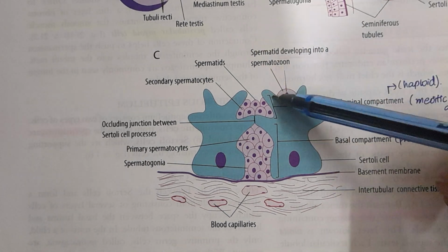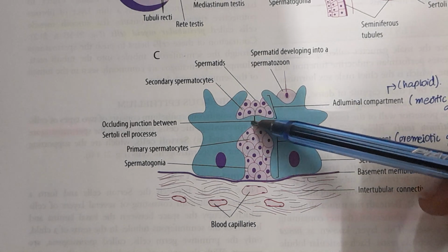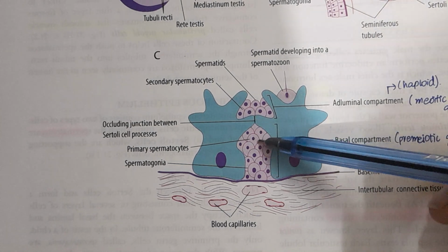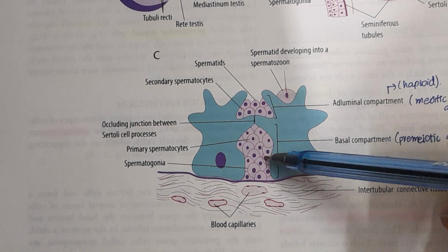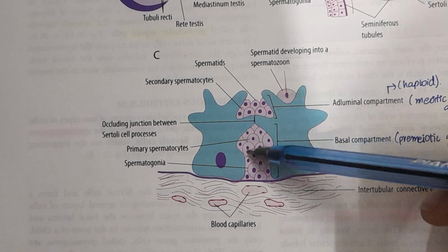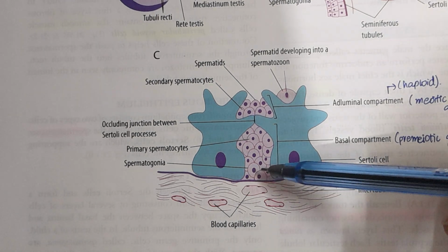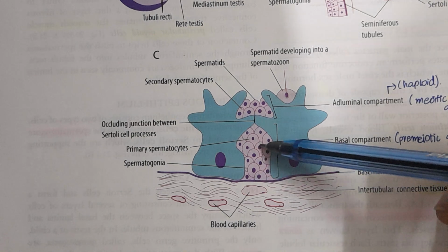A very important thing about their lateral portion is that they have cytoplasmic processes. These processes are joined to each other by zonula occludens or occluding junctions. These occluding junctions separate this region of the cells into two layers, one the diploid layer and the other the haploid layer. What is this diploid layer going to have? It has the type A spermatogonia, dark and pale, the type B spermatogonium, and undividing primary spermatocytes.